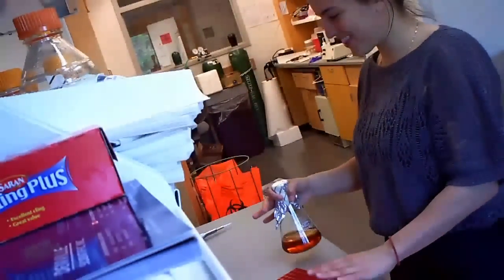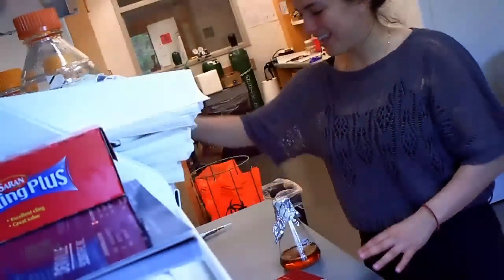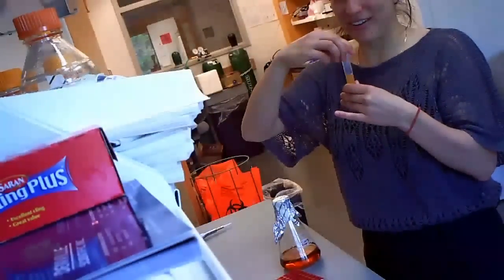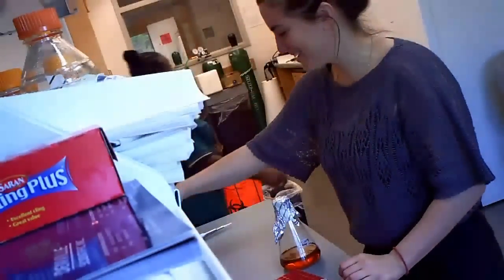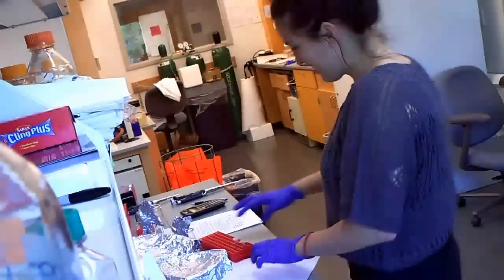Here's some yeast broth that I will measure. This yeast was grown overnight that you guys saw me grow.